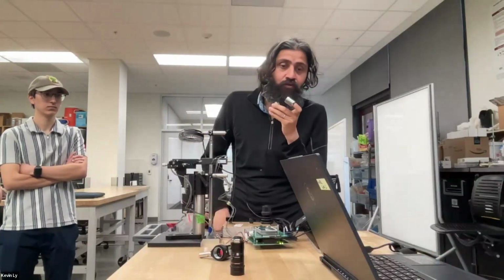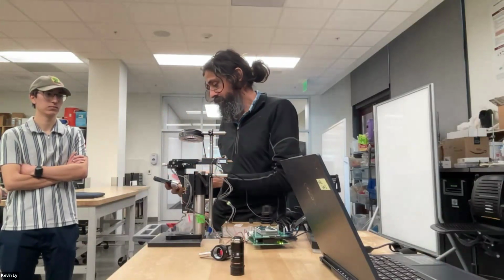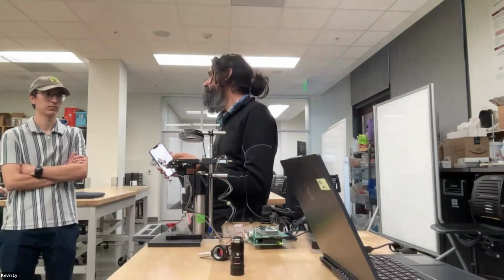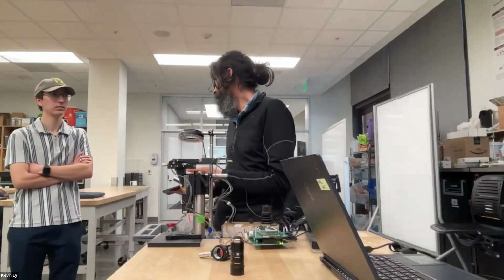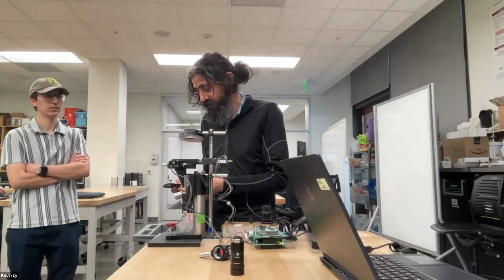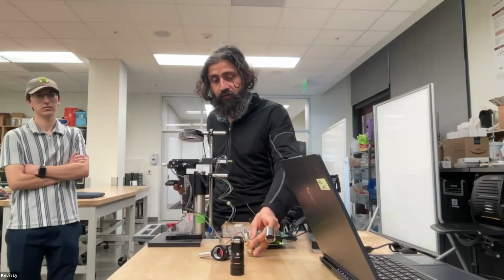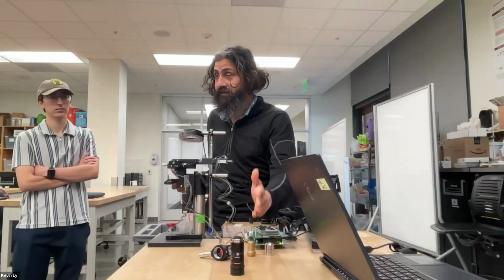Now if you just Google and search, let's actually look at what the answer is. It depends on the objective. So you're all right. There are objectives out there that have 100 optical lenses in a single objective, and if we had a chainsaw, which we will not do, you could actually cut this open as a slice.